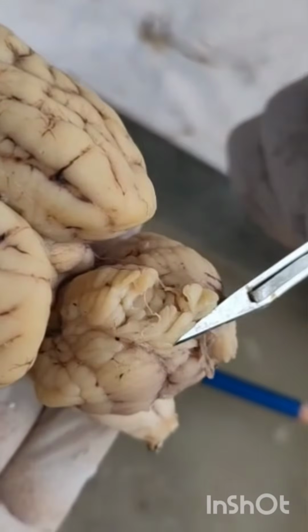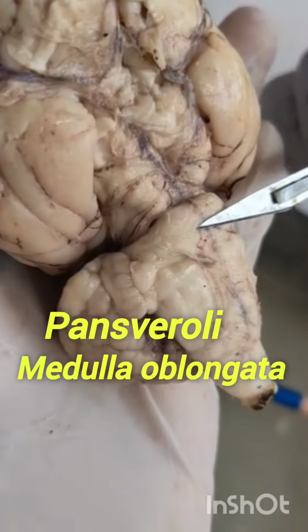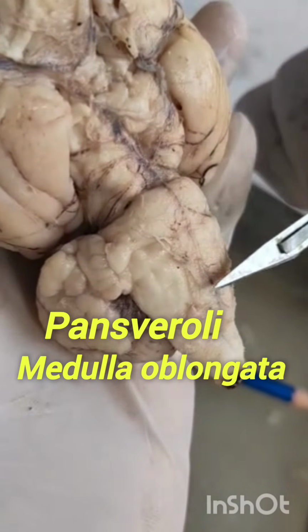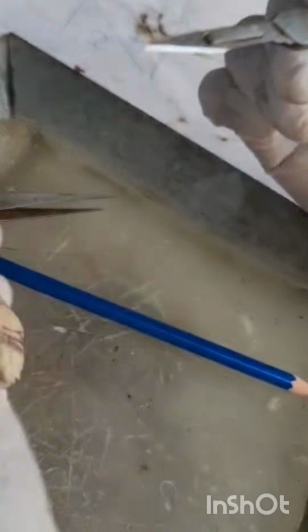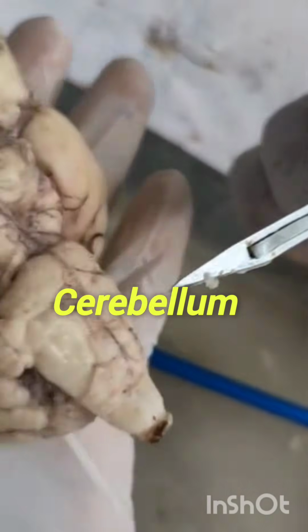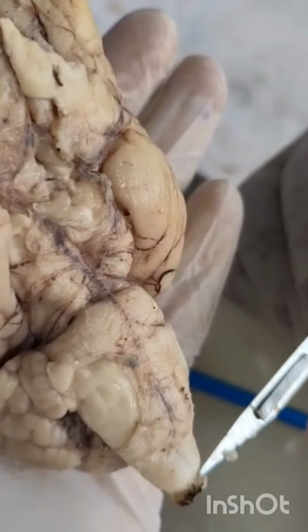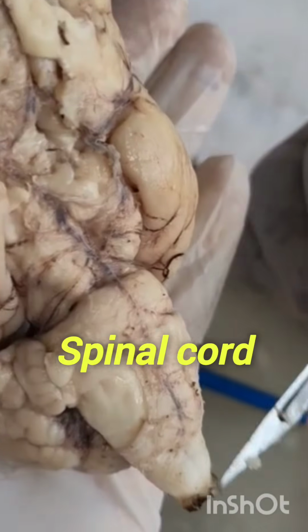Come to the hindbrain. This is the hindbrain. The hindbrain has 3 parts: pons varoli, medulla oblongata, and cerebellum. This is the cerebellum. Pons varoli, medulla oblongata. Further, the medulla oblongata continues as the spinal cord.